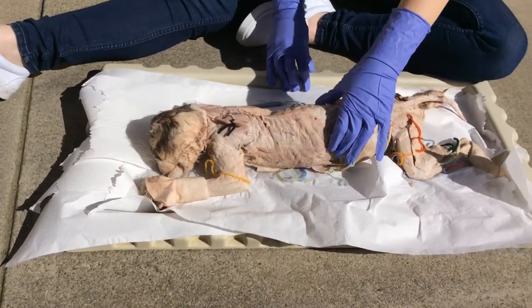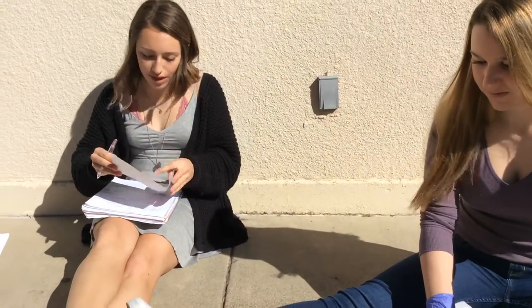Hi, I'm Emily, and I'm Amy, and I'm Jen, and this is Terrence, and we're going to help you learn about the back muscles that move the arm.